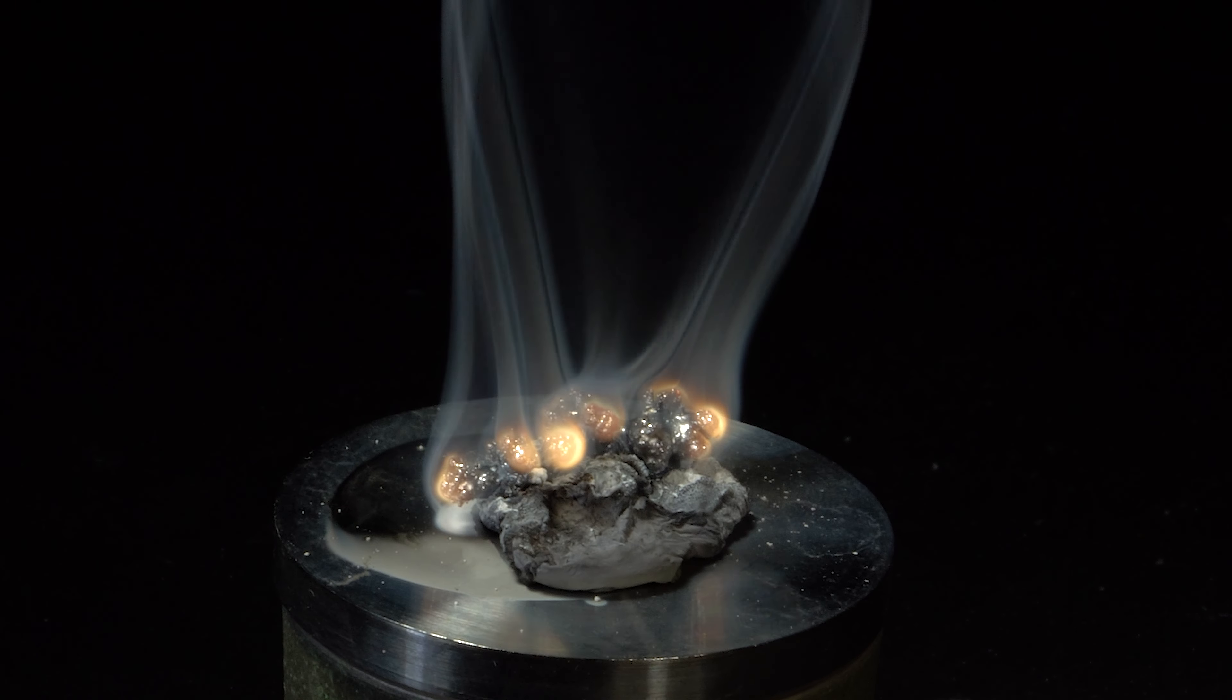This reaction starts at the fire point of lithium and carries out with the formation of lithium sulfide and lithium fluoride.